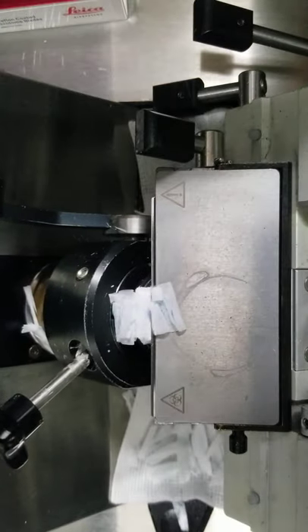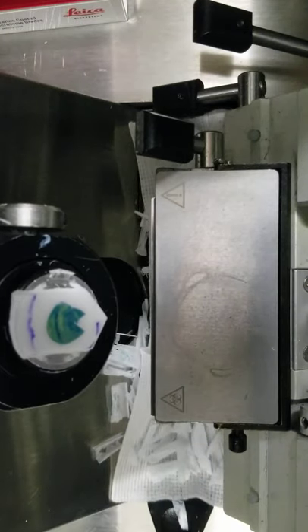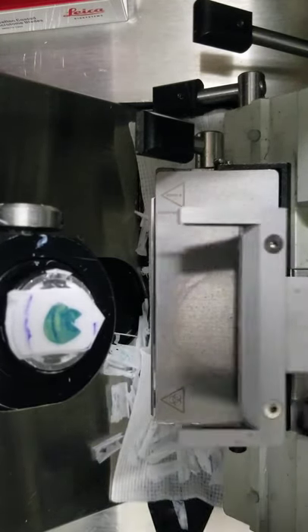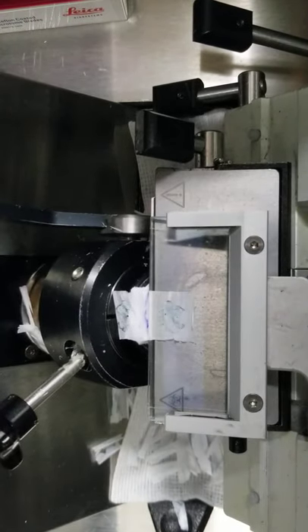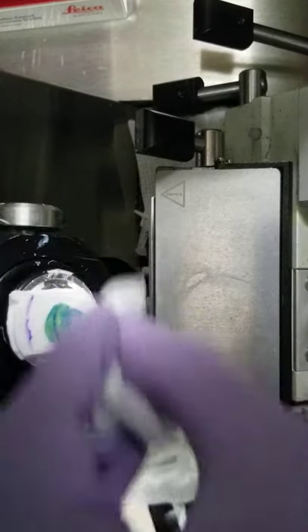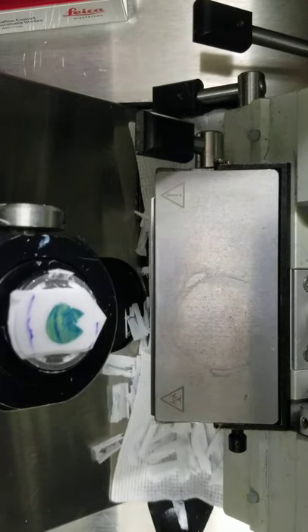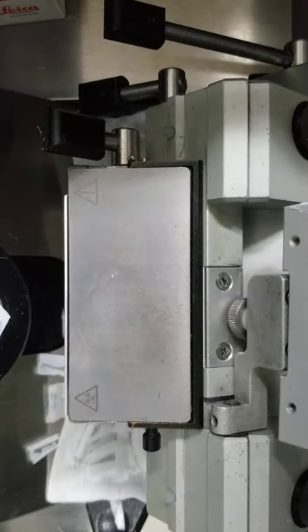So now, see if I can make it do that again. It's just like with a nicked blade, or, you know, if there's a calcium deposit. Of course, now it's not going to do it again. But it's just like having a nicked blade that will put a small rip or something in your ribbon. That's where you might have a buildup on the backside of the roll plate, and you can feel if there is a chip or a gouge mark on it.